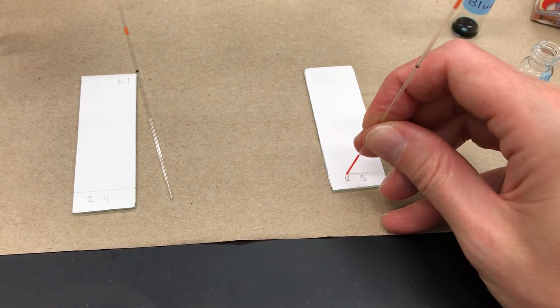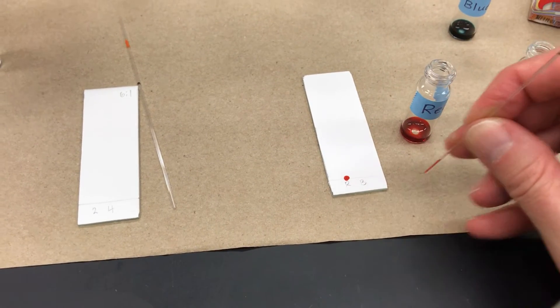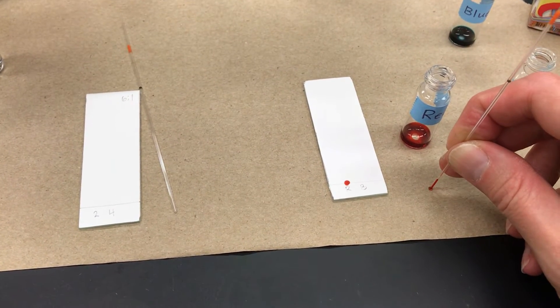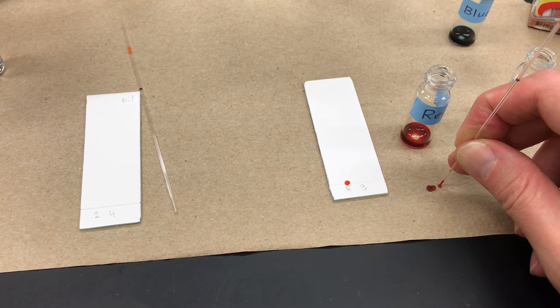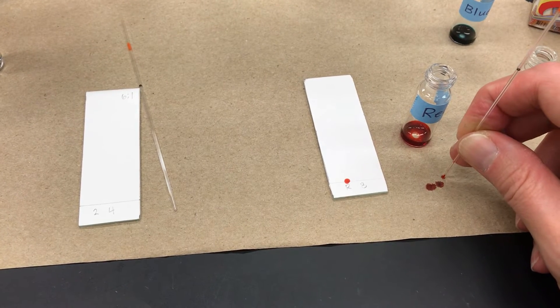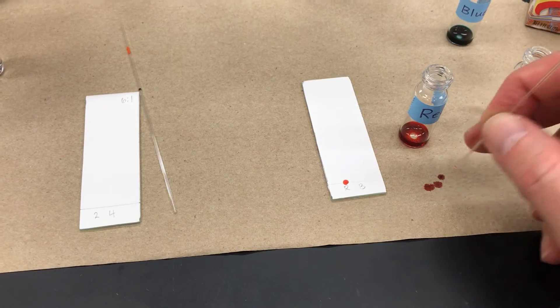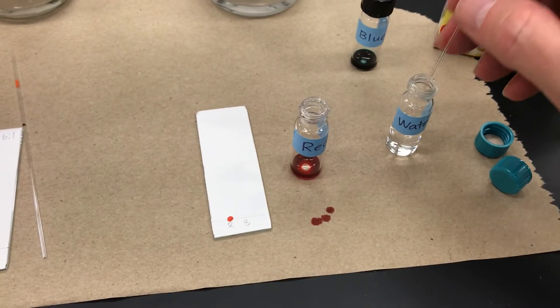I then put that to the spot. That's the baseline. And I use a quick down and up motion. You try to draw out a very small amount of liquid. This shouldn't be a huge spot. It should be at the most two millimeters in diameter.